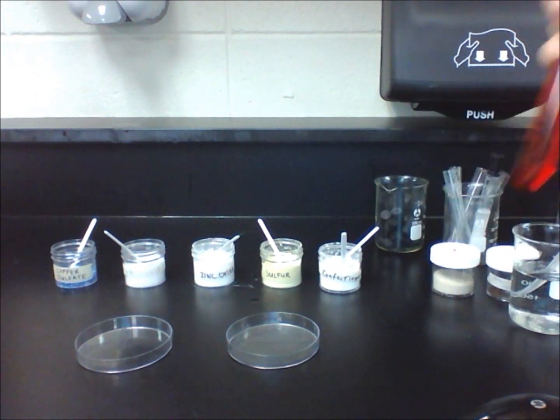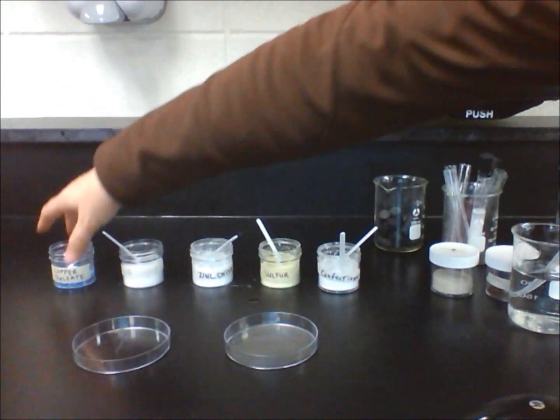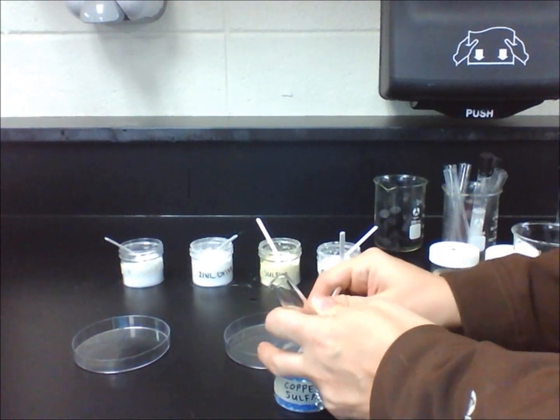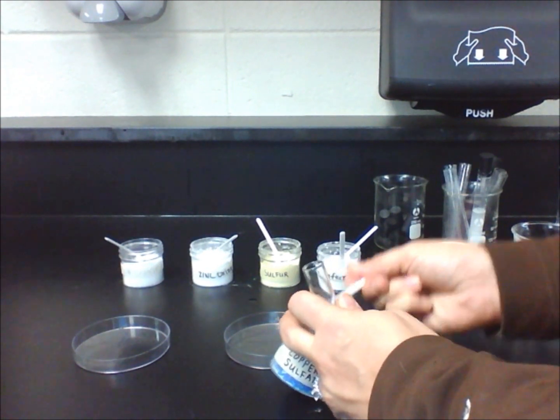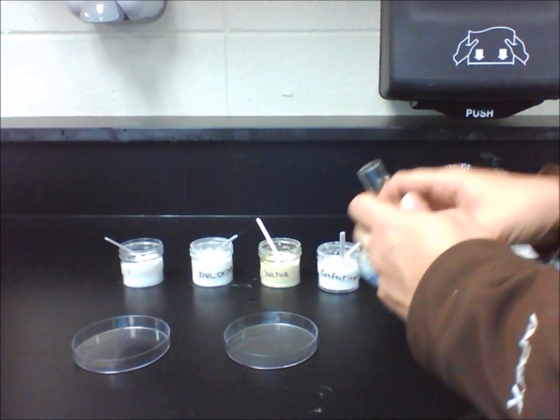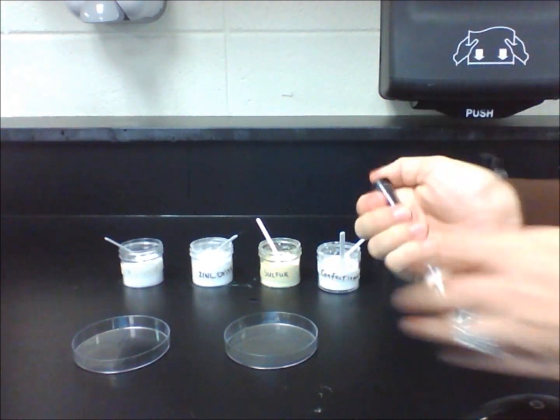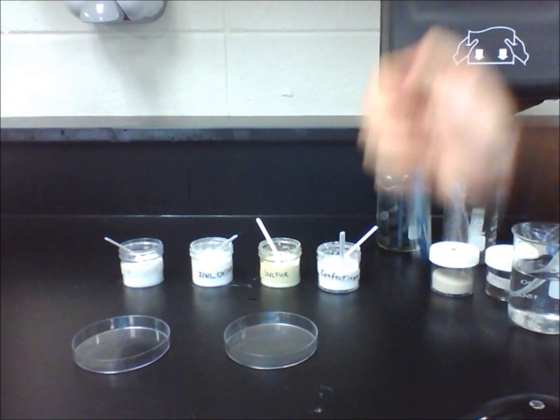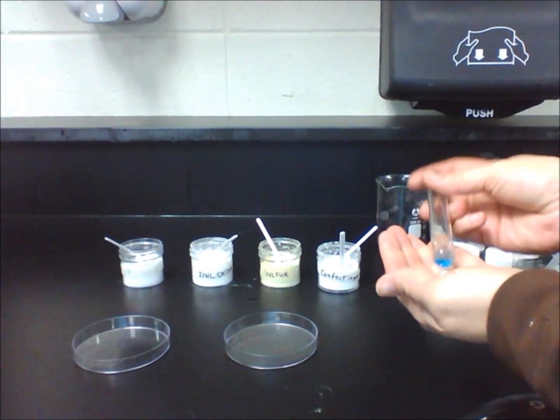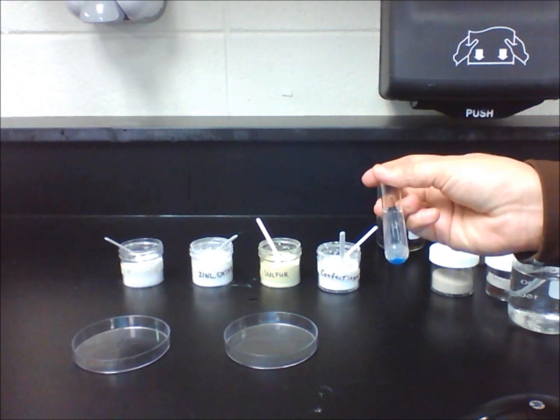Let's see what happens when five pure substances are mixed with water. We will start with copper sulfate by adding one lab scoop of the substance in a test tube filled with about 5 centimeters of water. Put a stopper on it and shake it 10 times. In your data table, write qualitative observations of the appearance. You will notice that the water has turned a light blue color, and even though there are still some crystals left at the bottom of the test tube, the water changing color is evidence that the pure substance did dissolve.